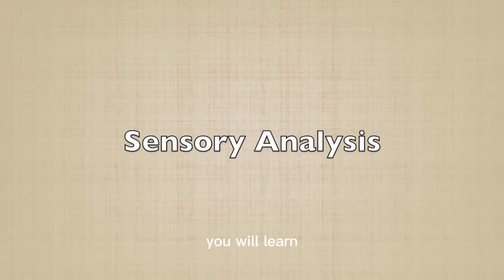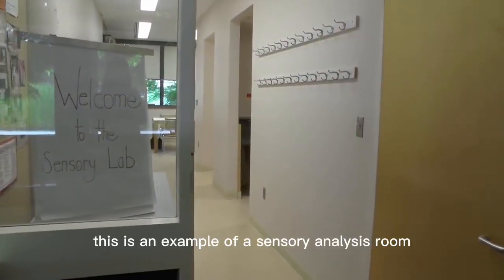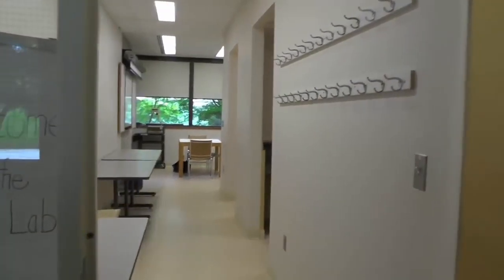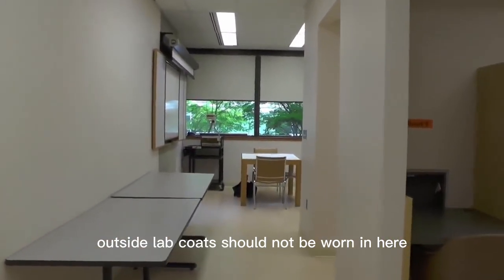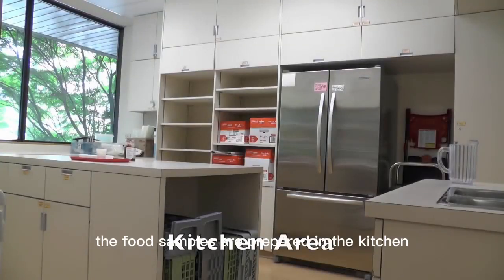In this video, you will learn how to set up and conduct sensory analysis. This is an example of a sensory analysis room. Because this is a food-safe environment, outside lab coats should not be worn in here. The food samples are prepared in the kitchen, which is separated from the tasting area.